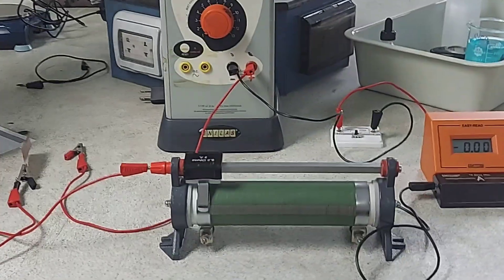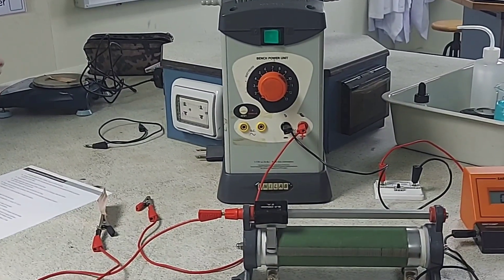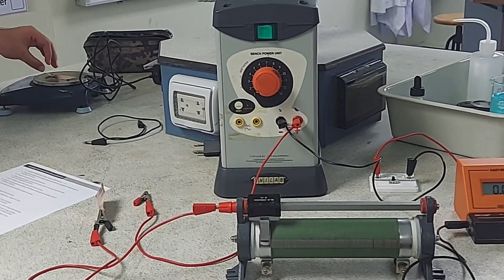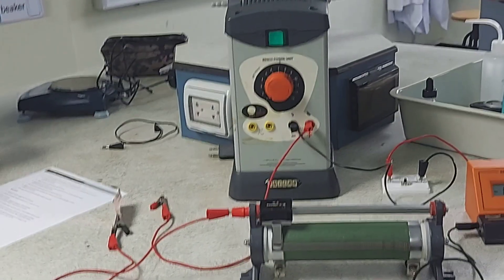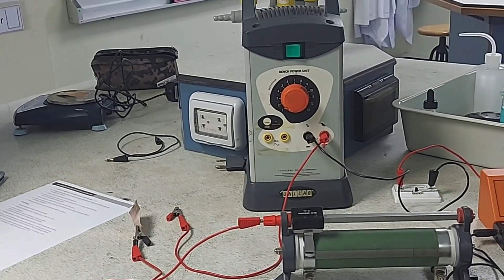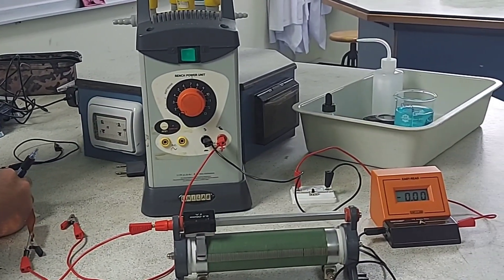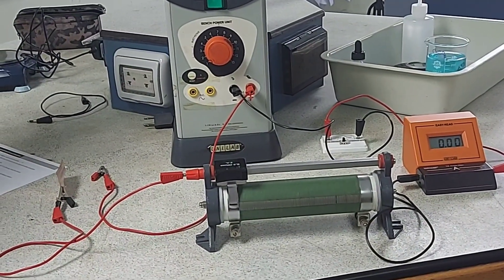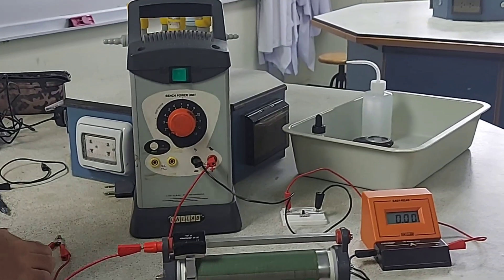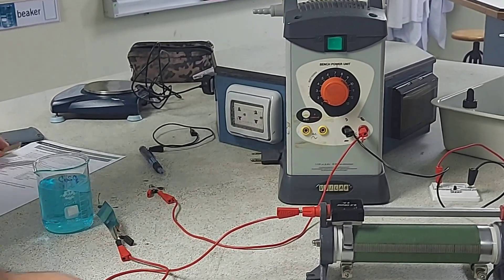The student is still connecting the circuit, and once ready he will measure the mass of the anode. The mass of the copper anode is taken and noted. You will need two clamp stands to connect the electrodes and dip them into the copper sulphate electrolyte.